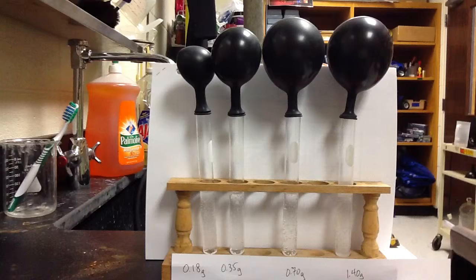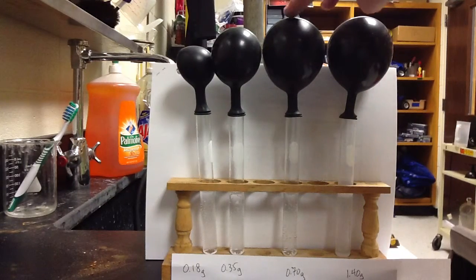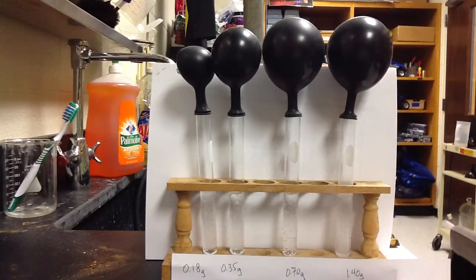It's never going to be perfect in terms of how they look, because sometimes the balloons form in different shapes. But pretty much what you'll notice is that these form the same amount of gas, test tube 3 and test tube 4. What we can notice in thinking about limiting and excess reactants is normally we think about how much product is being made in a reaction, and that helps us determine the limiting and excess reactants.